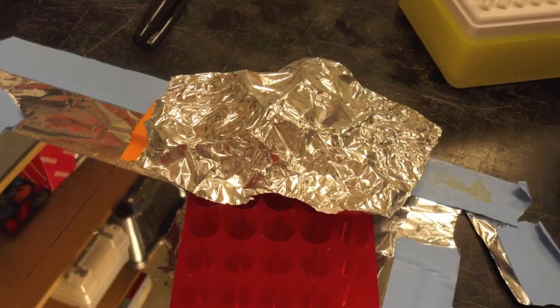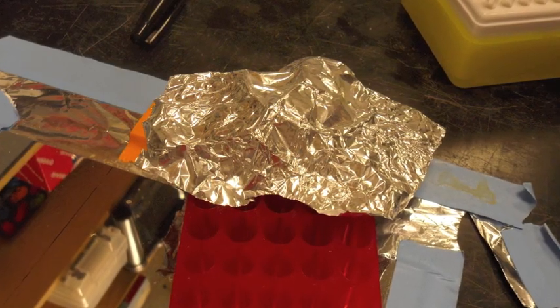Remember, PEG is light-sensitive, so keep it covered at all times unless you are currently working with the sample.